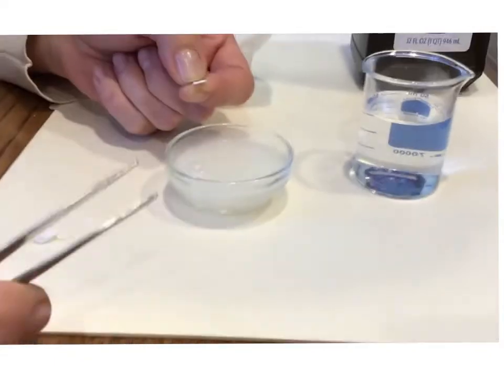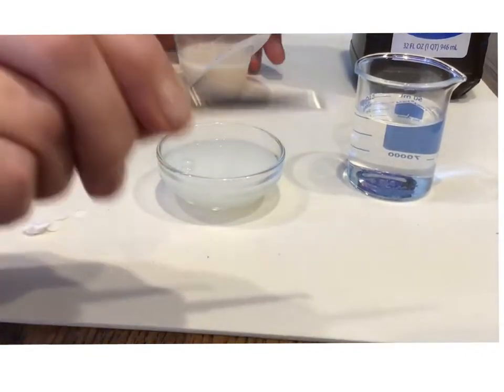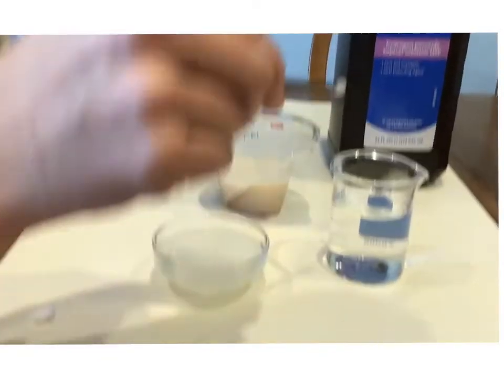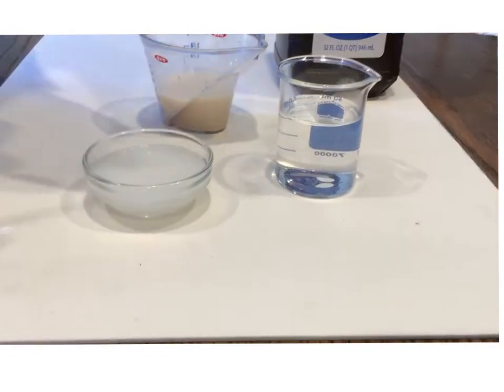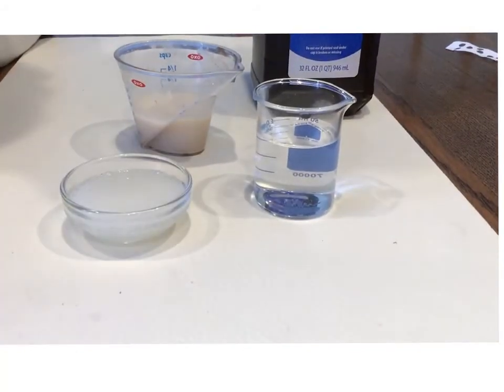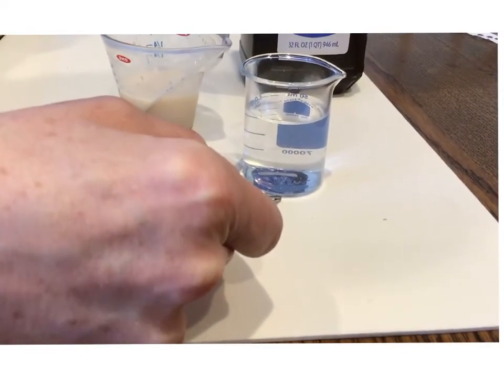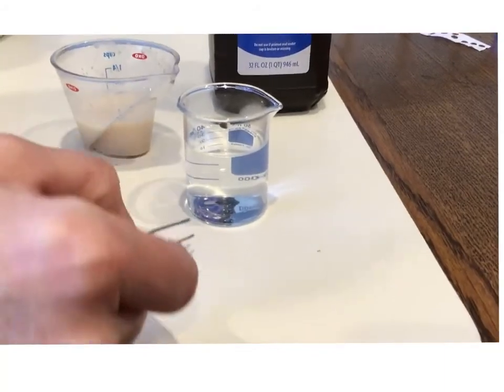So here I have hydrogen peroxide, and in this lab, what we would do is take this little paper disc and dip it into the yeast solution. And what we're going to do is drop it down, and you can see that it's down at the bottom and it floats up to the top when there are enough bubbles there to carry it up. What the scientist would do is measure the time from the moment it goes in to the moment it hits the top.